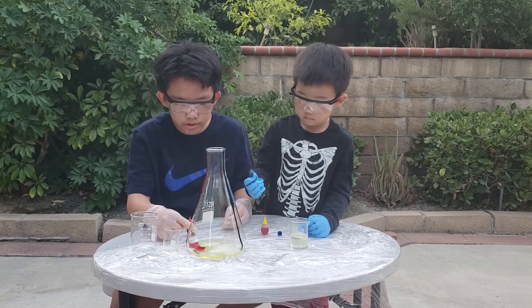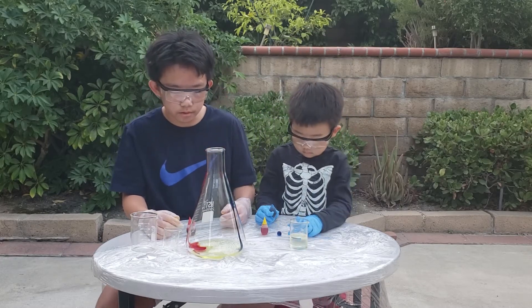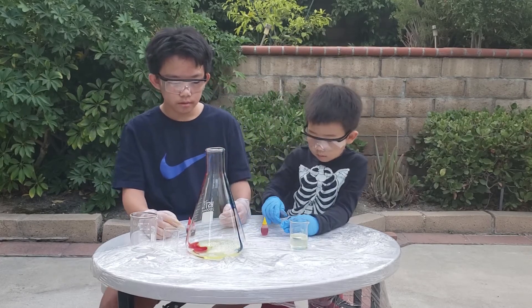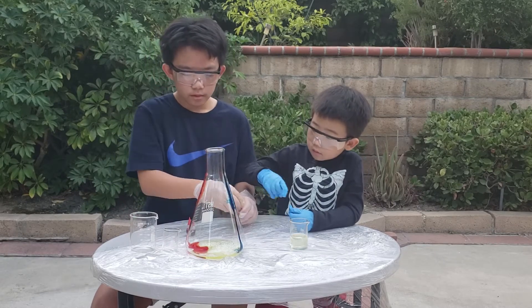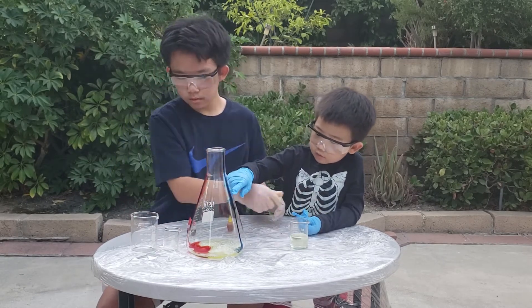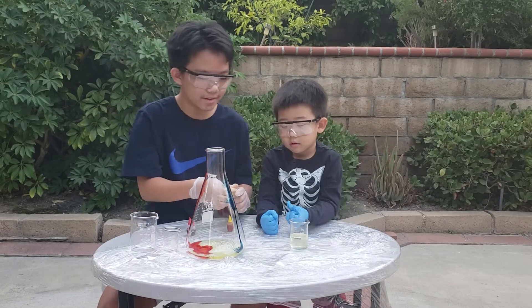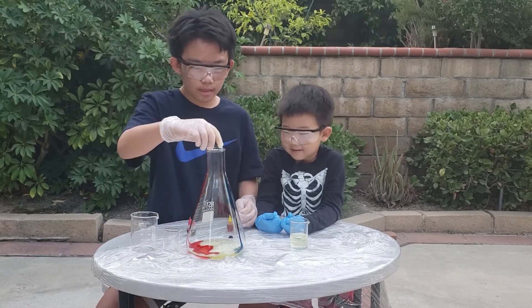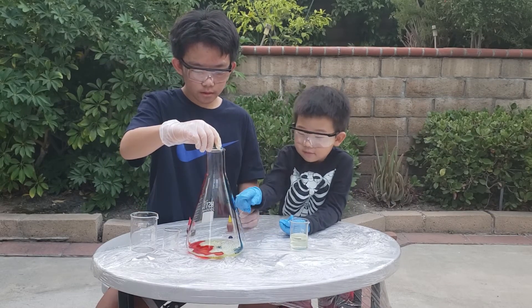You can see that the red color is spreading due to a process called diffusion. It looks a lot like blood vessels. Yeah, blood vessels.